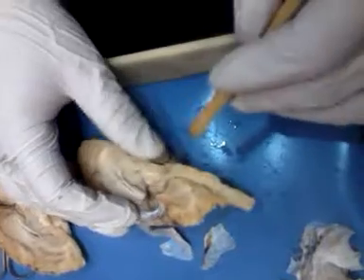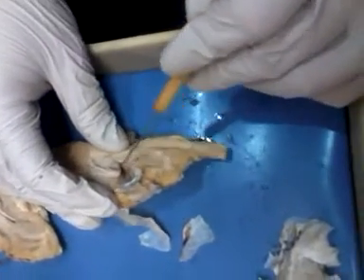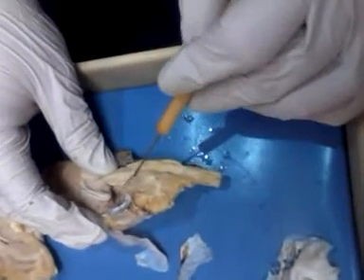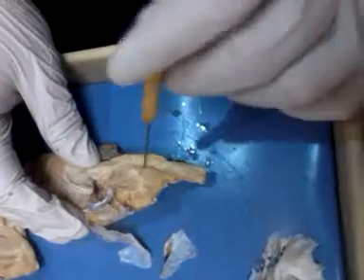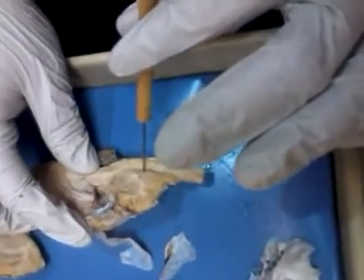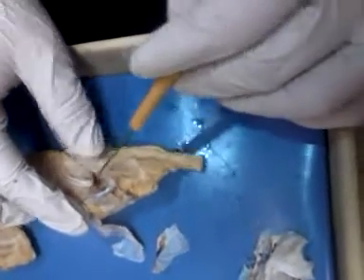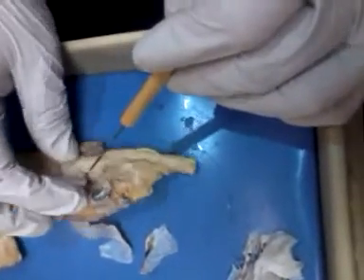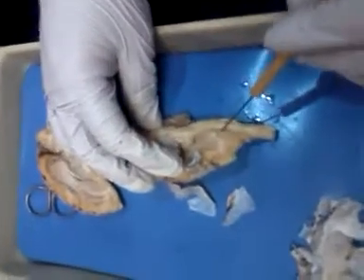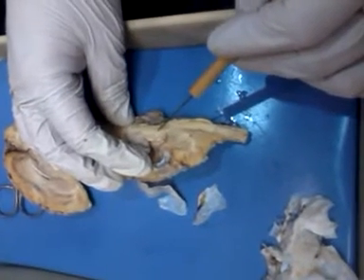Okay. Then, see your lateral ventricle, you come down here, there's kind of like a groove through there. That is your cerebral aqueduct, okay? And it ends up down here at the base of the tree, fourth ventricle, okay? So the liquid comes through here, goes down through a third ventricle that you can't really see, down this cerebral aqueduct, fourth ventricle.